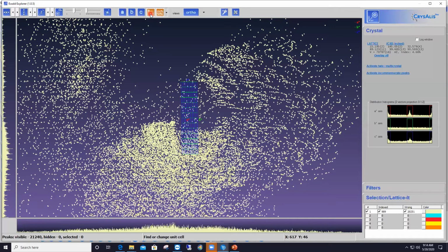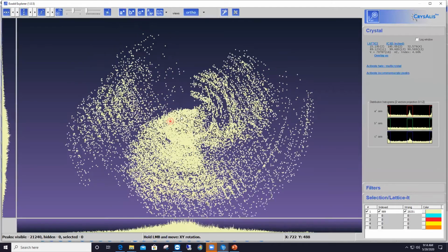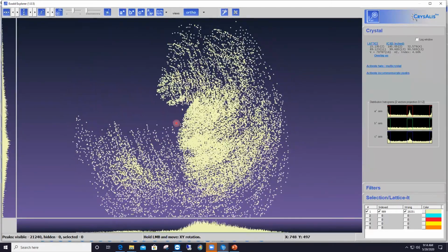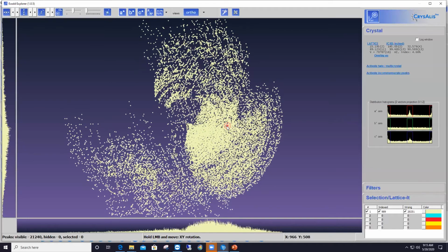So the game for me now is going to be to rotate around this diffraction pattern until I see rows of reflections bathed in that sea of ice features. To do that, I will left click on the view here and rotate around until I see rows of reflections. If I see rows of reflections, I know that this will be the part of the diffraction coming from the crystal, and then I will apply the Lattice-It feature to those rows of reflections.